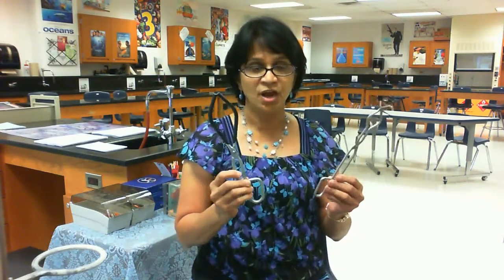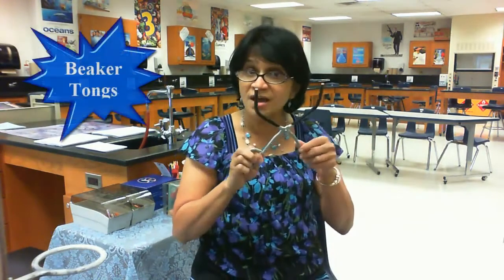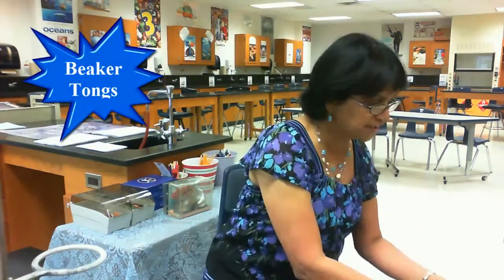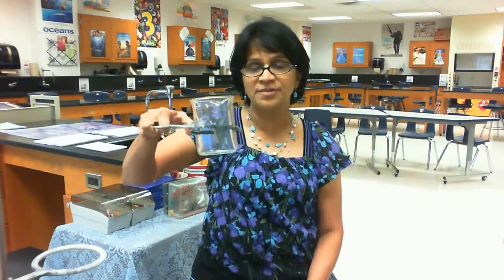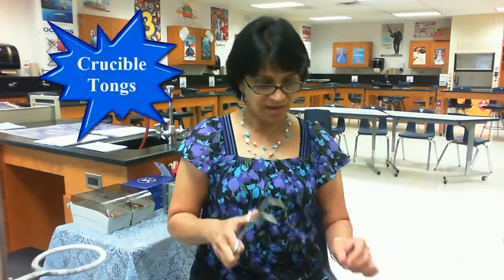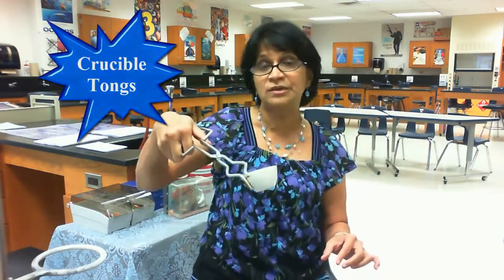Alright, moving on, we have these two things. Now they both might look alike, but they are different things. One of them, which has wider tongs here, is called beaker tongs. It can be used for lifting a beaker like this. So if the beaker is hot, we can lift the beaker using the beaker tongs. The other ones are crucible tongs, and let me show you.